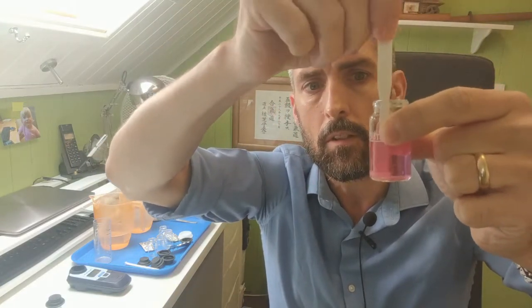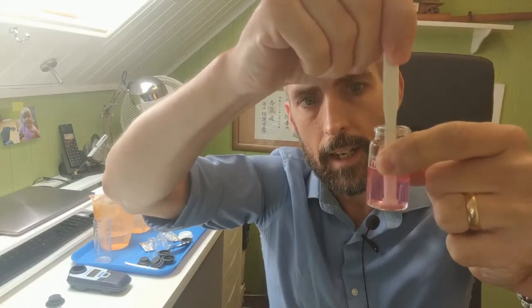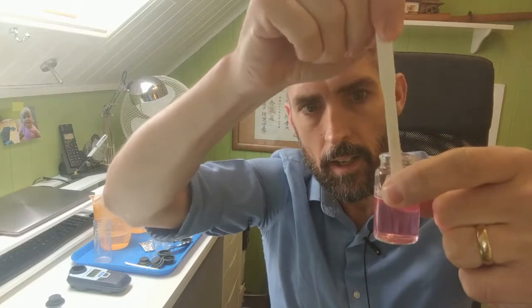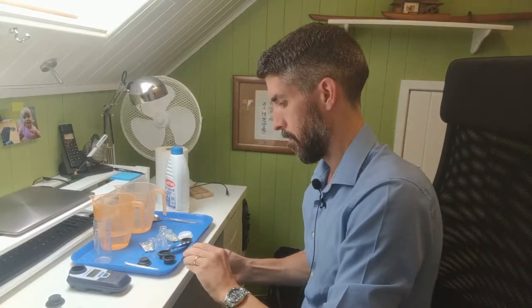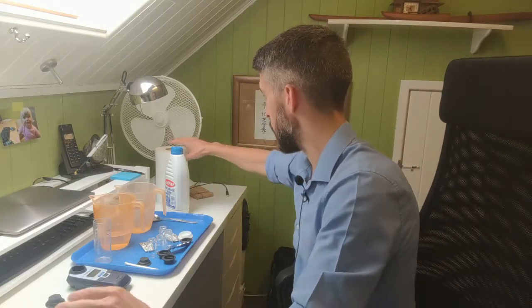Let's carry on mixing it up. A tiny bit of pink has remained, but it's gone very, very clear now, or very much lighter. Something's not right there. If we put that in the photometer, it would probably be quite a low reading that we'd get back.